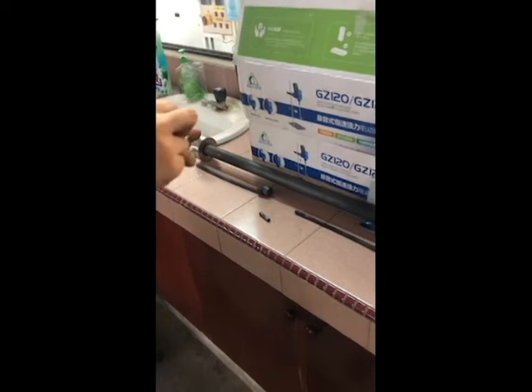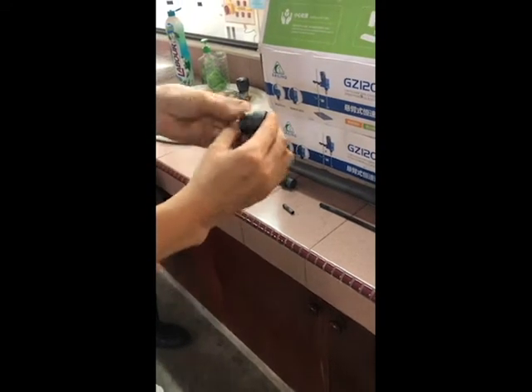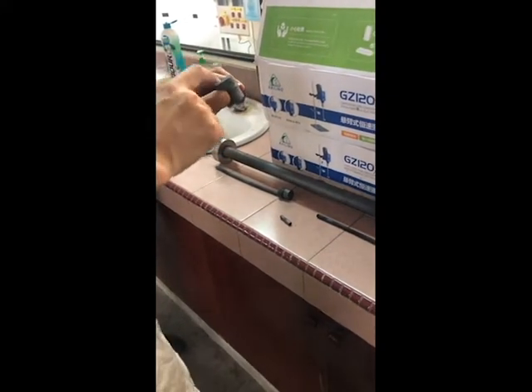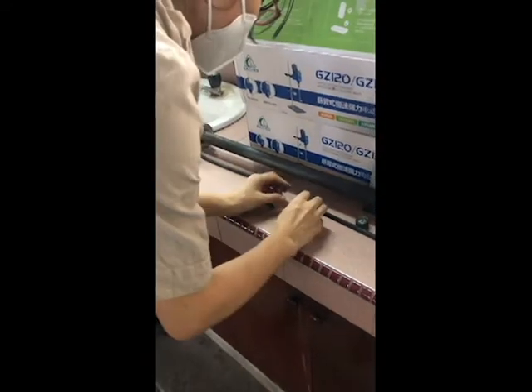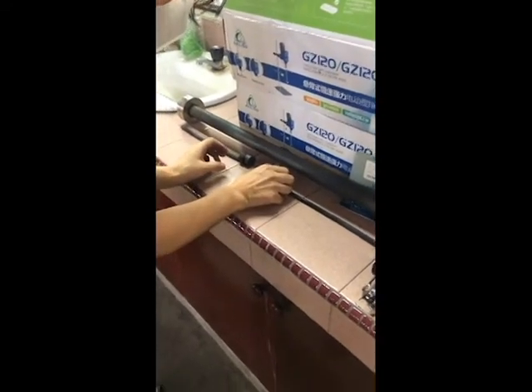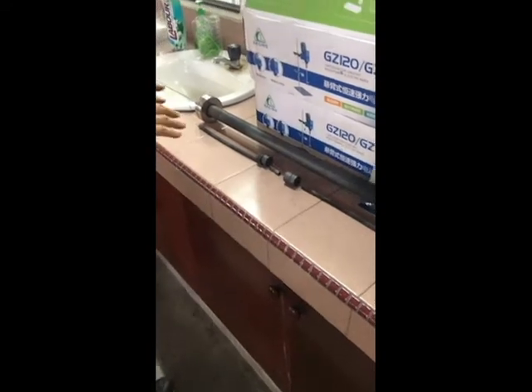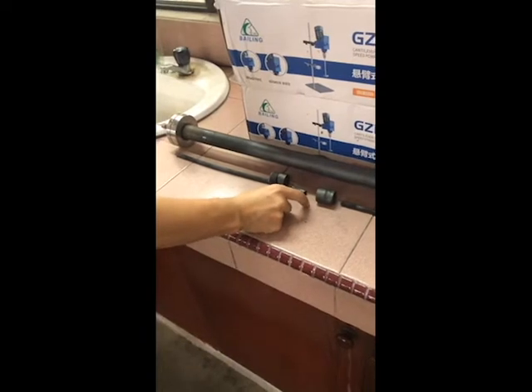This time we will use help from the quartz wool, and the quartz wool will be put in the middle of the tube. We will use 2 gas distributors to lock the quartz wool in the middle. Then only gas passes through, but no catalyst either leaks from the bottom or escapes from the top. So we put our 2 gas distributors here, but you still need space. You need a space for you to load your catalyst. So the inside is distributed like this. Your catalyst is locked here in the middle of the constant area.